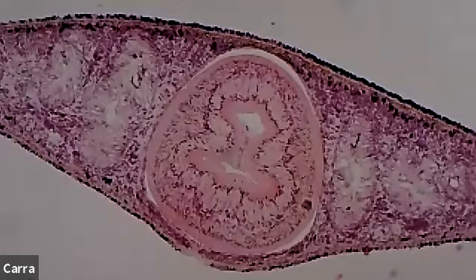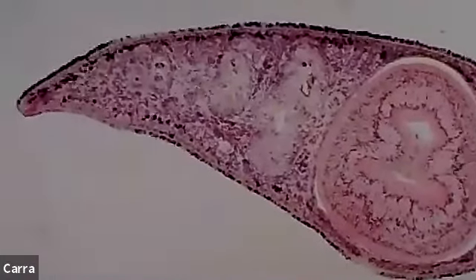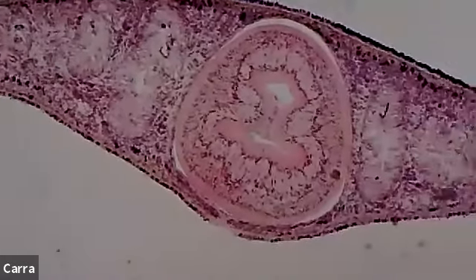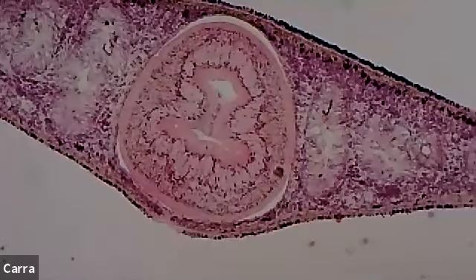So the planarian body itself, which is kind of this oval shape. So we were looking at it earlier, the overall thing. So here are the tips, right? So that outer surface is going to be your ectoderm. And then the inner part is the mesoderm. And then the inner part where you can see these kind of cavities dispersed throughout, and you can actually see them.